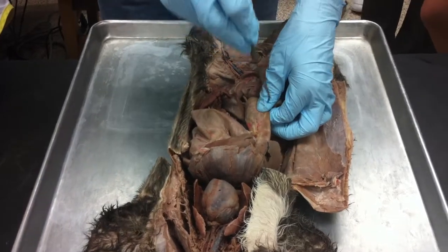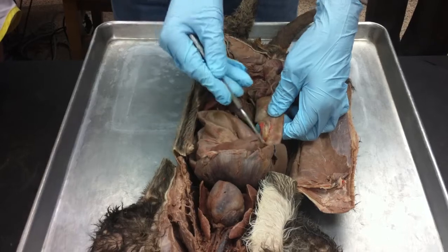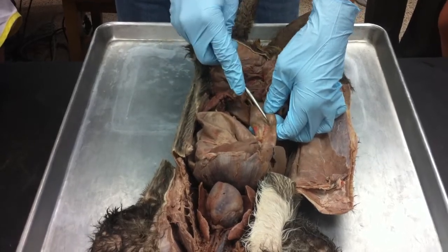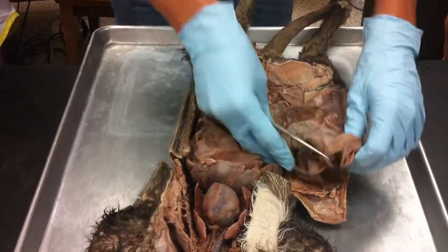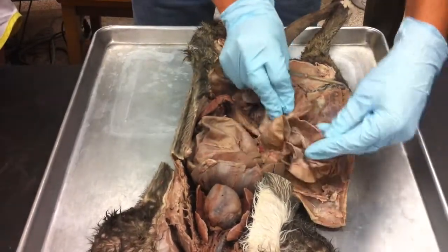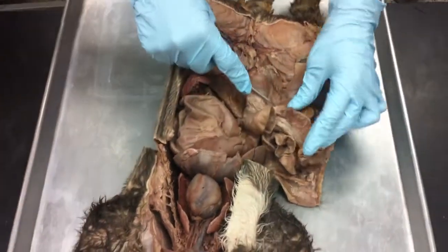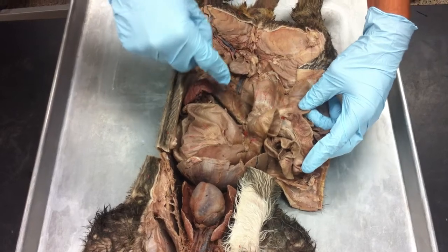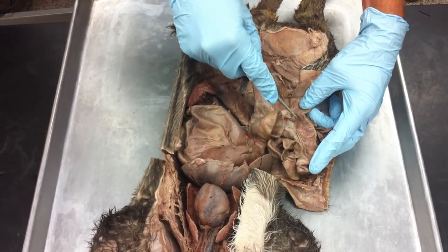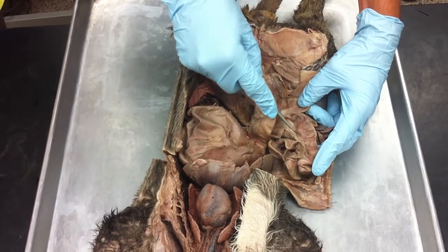Okay, so I'm going to put a pin right there where you can see the stomach, and then you can see this is clearly the small intestine, so it's the first part of the small intestine, that's going to be the duodenum. Then all the rest of this is all small intestine, and then you get down to here. This is still a small intestine right there, but then all of a sudden it empties into this really big thing. That's going to be the colon, right? Or the large intestine. So that means that this is the last part of the small intestine, which means it's the ileum. Okay?